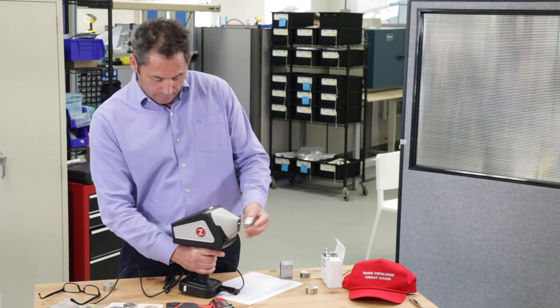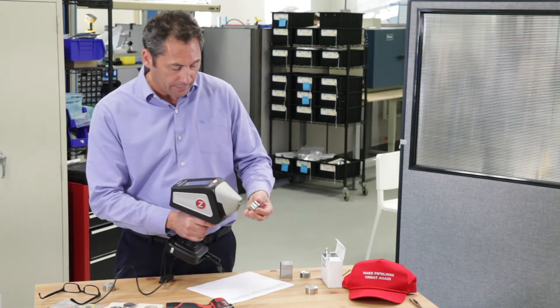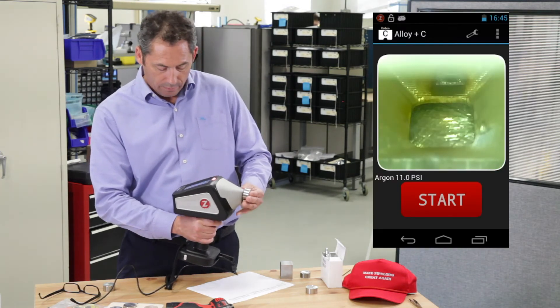Nope, I didn't reset it. Let's reset the analyzer, cancel that result, burn it.